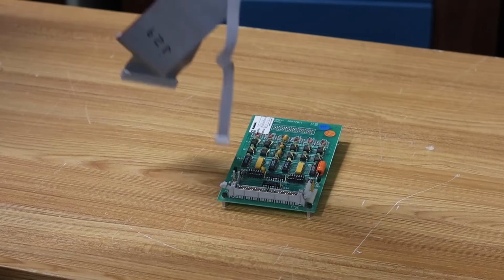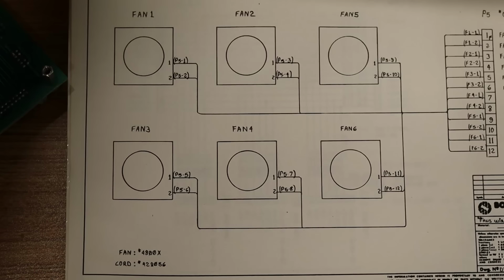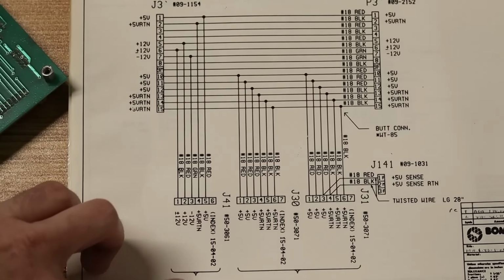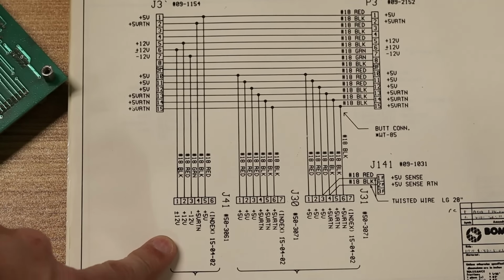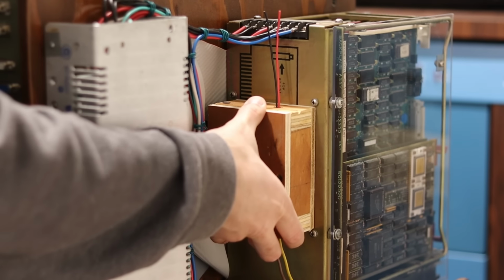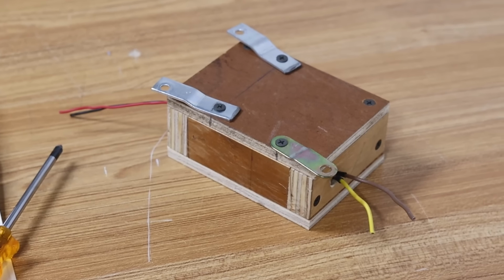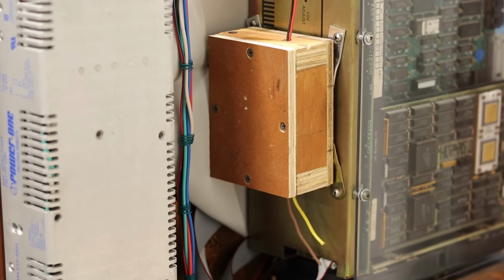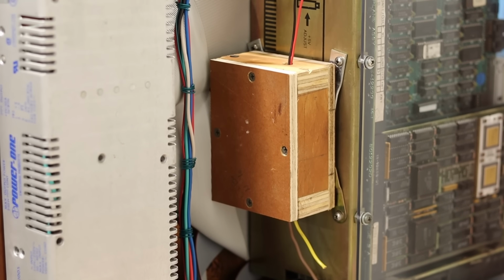I'm going to need to make a 50-pin ribbon cable for the vector processor, a 10-pin ribbon cable for the serial, and some cables for the power. Looking in the manual, it seems this thing needs plus 5 volts as well as plus and minus 12 volts. My PDP-11 only has plus 5, plus 12, and minus 5, so I'm going to need to add another 12-volt supply for negative 12 volts. This is a little wall wart that I built into a box, so I'll bend up some tabs and screw them into the box, and then I'll bolt the whole thing to the back side of the card cage.